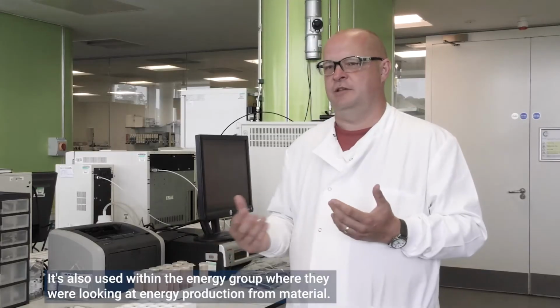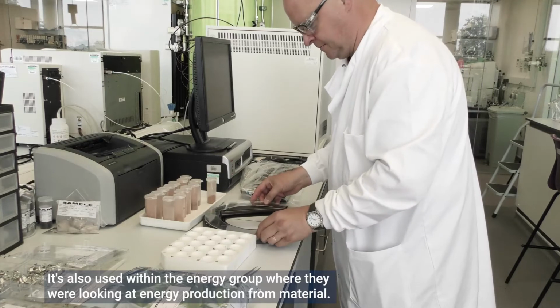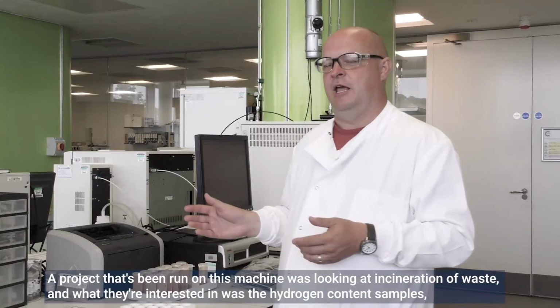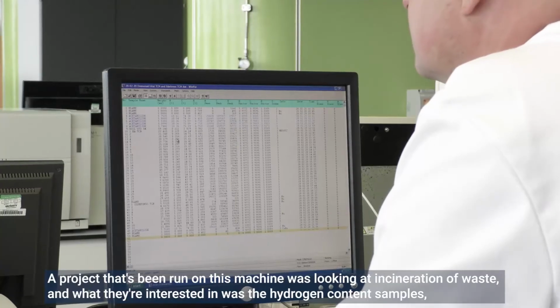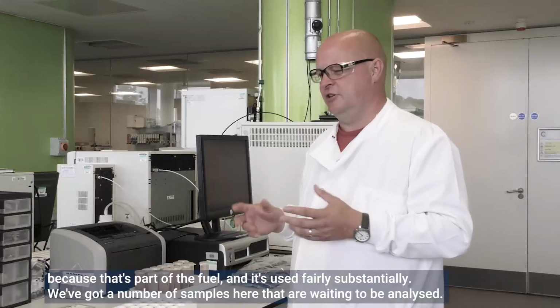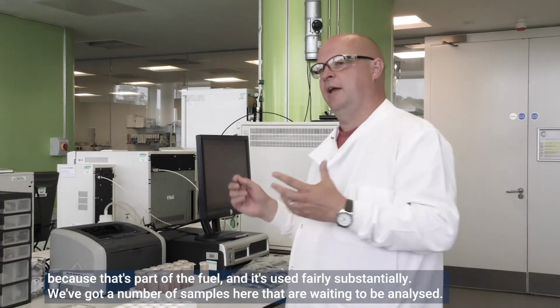It's also used within the energy group where they were looking at energy production from material. So a project that's been run on this machine was looking at incineration of waste. And what they were interested in then was the hydrogen content of samples, because that's part of the fuel. And it's used fairly substantially. So we've got a number of samples here that are waiting to be analysed.